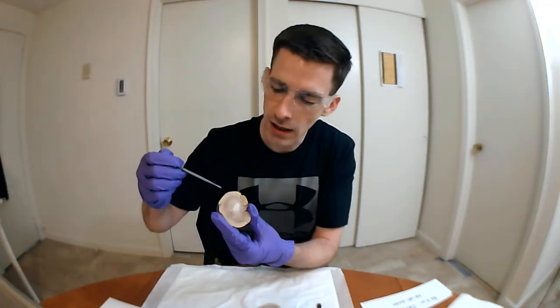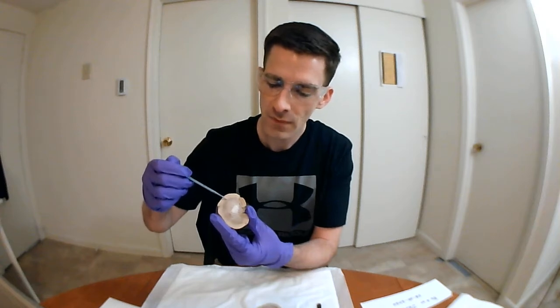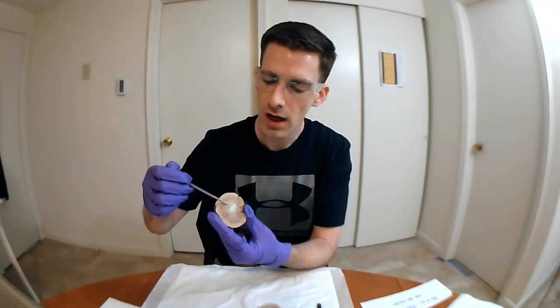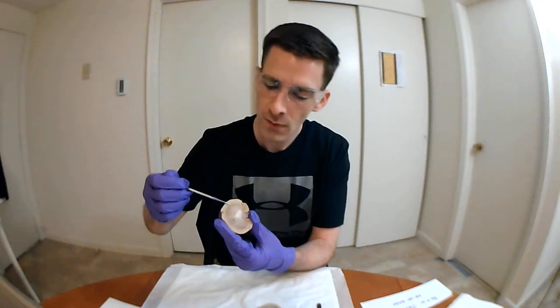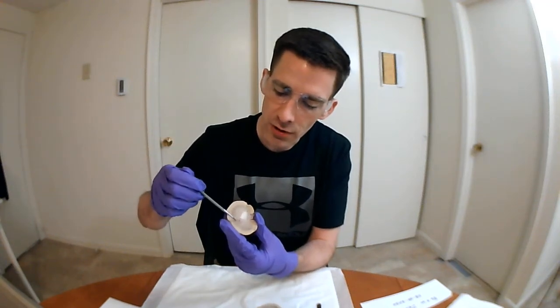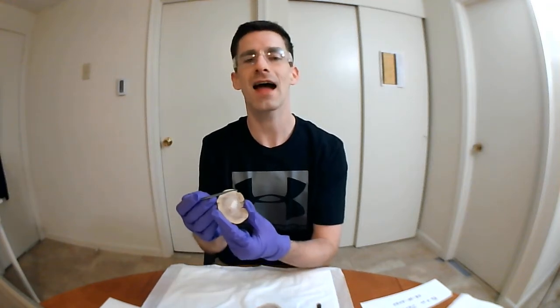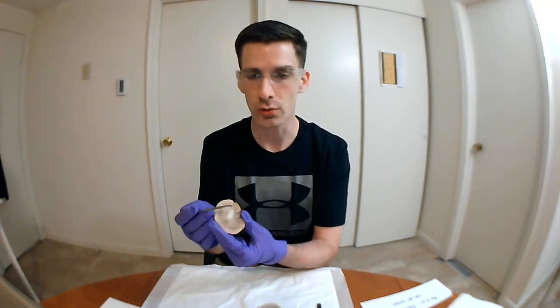The renal medulla, you can see deep to the cortex here, and this is more inner kidney tissue that's split into various renal pyramids. So here you can see a renal pyramid and another and another. The average human has 6 to 18 of these renal pyramids, which are shaped like cones.